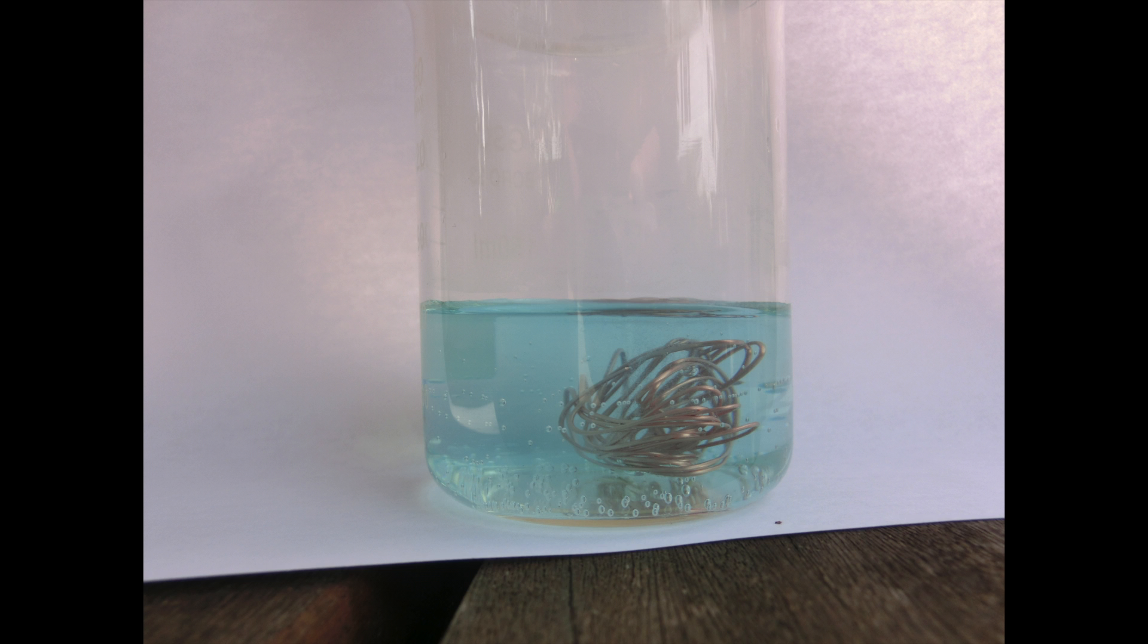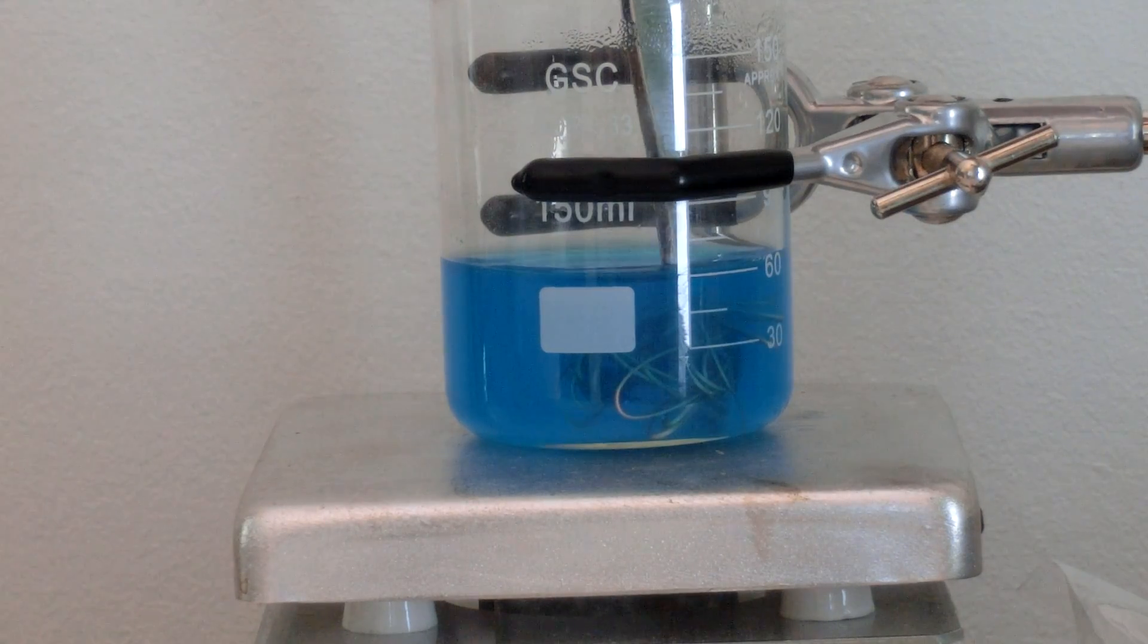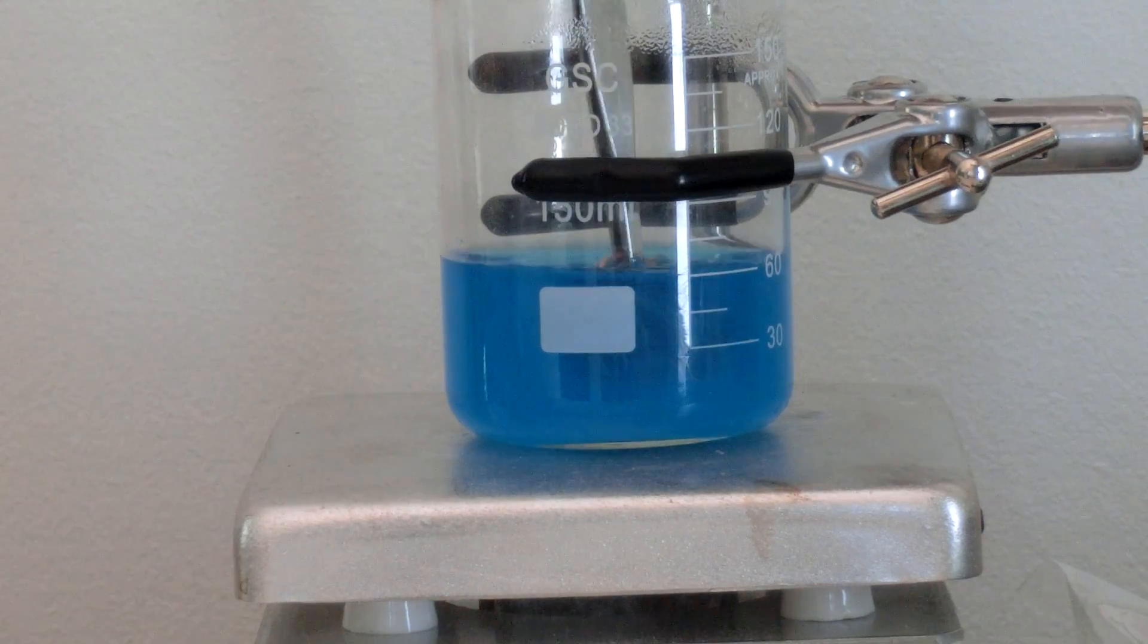Here it is on a white background partway into the experiment. Here is the solution after it stopped bubbling. It should be a deep blue. The copper should be removed and the solution should be brought to a boil.